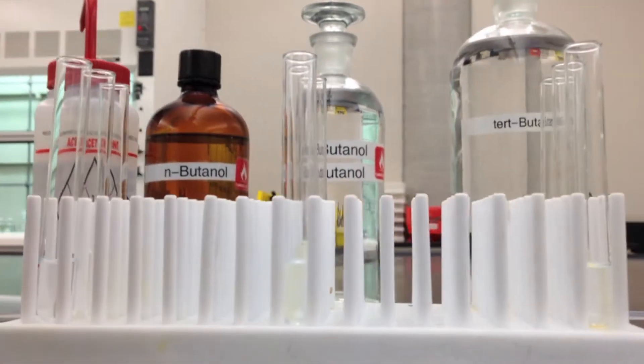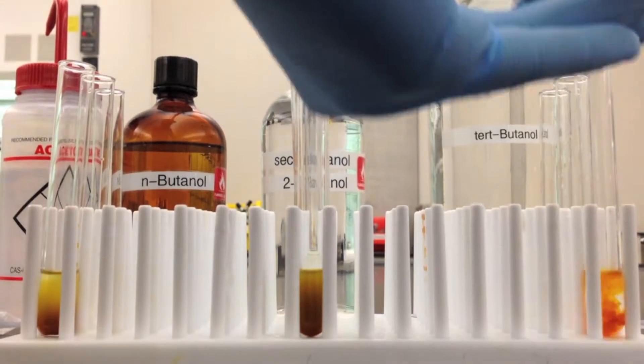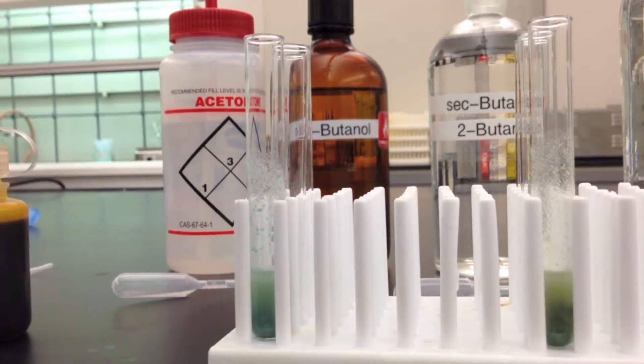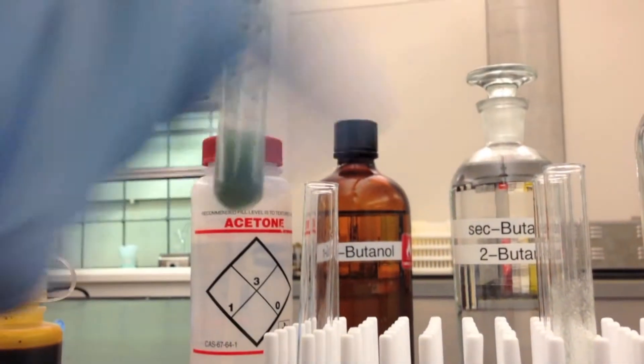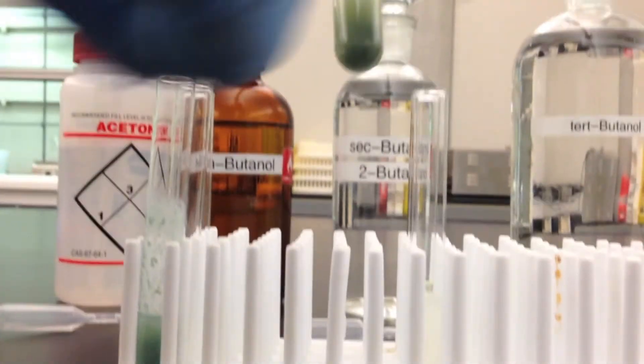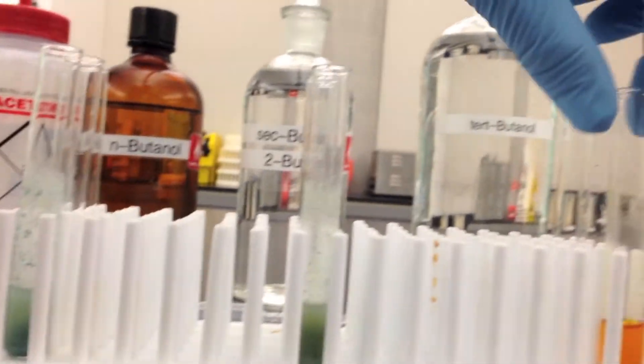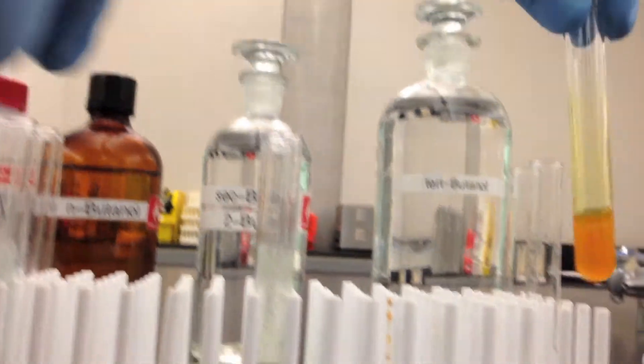Now that it's dissolved, you want to add just one drop of chromic acid. Now this green, the green reaction is what you're looking for, for a positive result. And it should form between one and ten seconds after the addition. And these were pretty immediate.